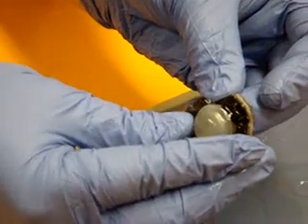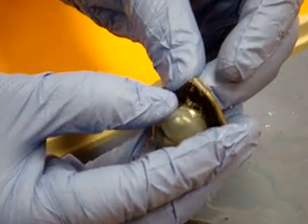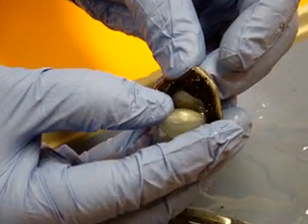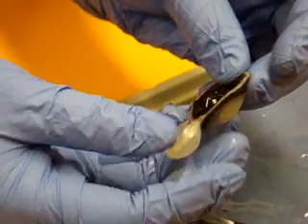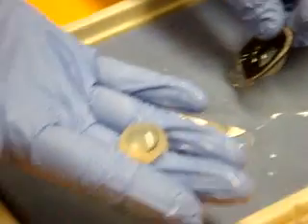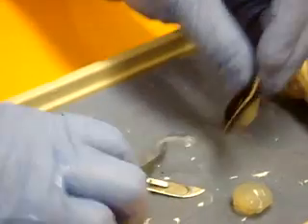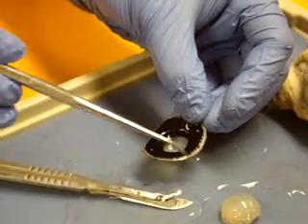Let me get some more of that jelly stuff off — you probably won't see the suspensory ligaments because they're clear and I'm detaching them as I pull it out. You might be able to see them as they detach. See those little strings? I've broken those suspensory ligaments now. So here is the lens, and you can see how it was sitting within the ciliary body.